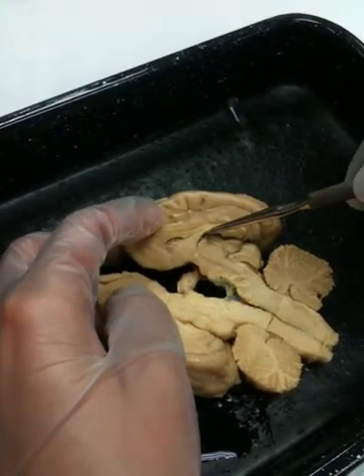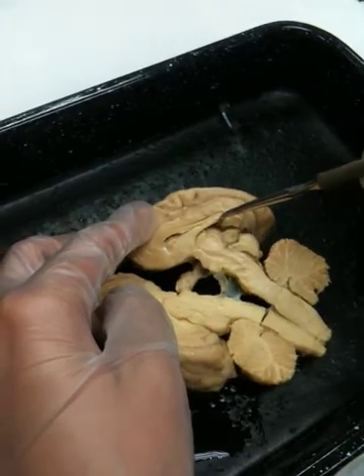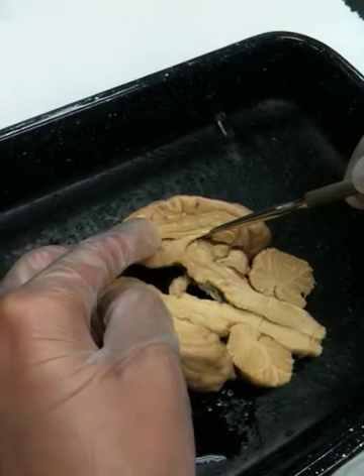So we have half of it in this hemisphere and the other half over there. It comes down and surrounds this entire region. This large structure here passes right through the center of the third ventricle. Okay, so here's a lateral ventricle.